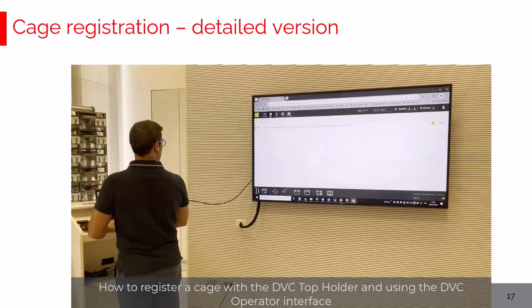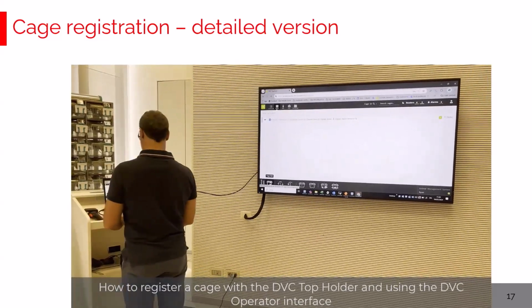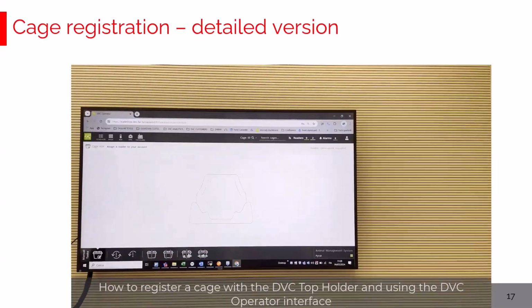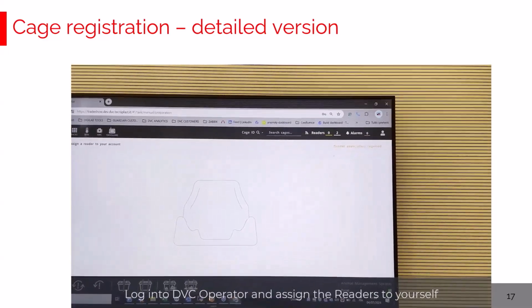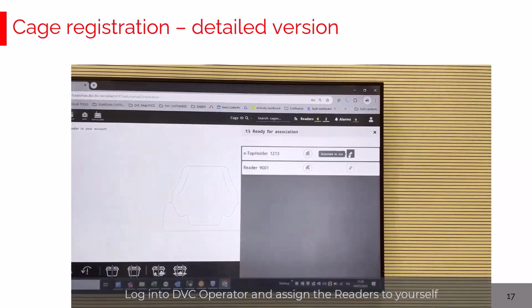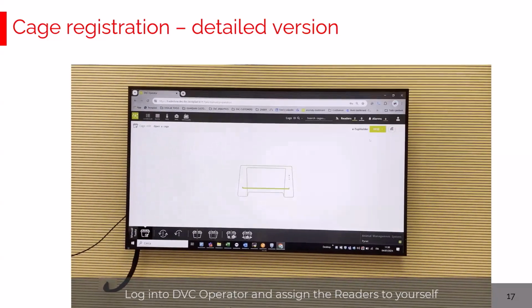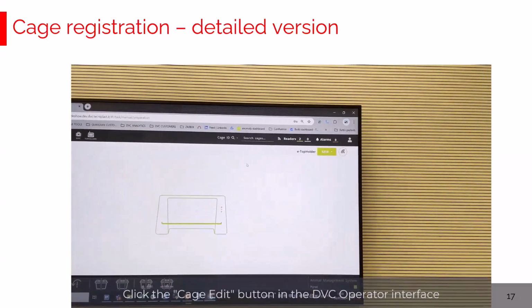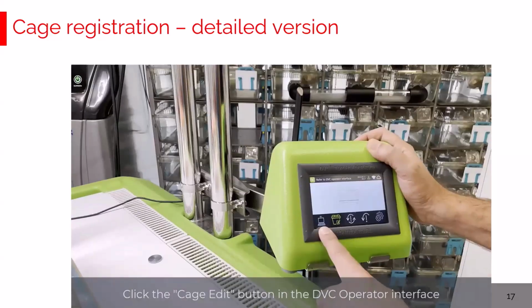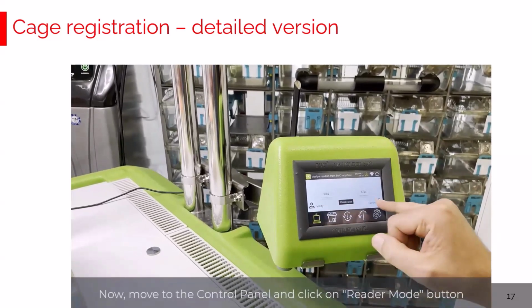Okay, so now let's see the second way to register a cage. In this case, we are going to use the button Cage Edit in the DVC Operator interface. And then you remember the DVC top holder, we need to associate these readers to the user logged into the DVC Operator interface by clicking that button, the little chain, and then the readers are assigned to the facility user in the DVC Operator interface that now is requesting to use the reader 1213 to open a cage. Let's go to the control panel. By clicking the corresponding button, you can verify that the readers have been assigned to the facility users.